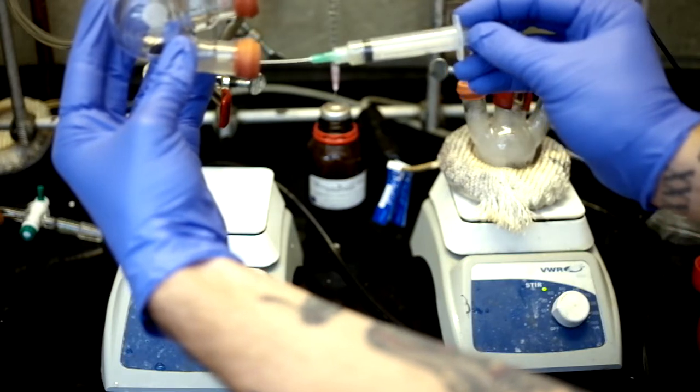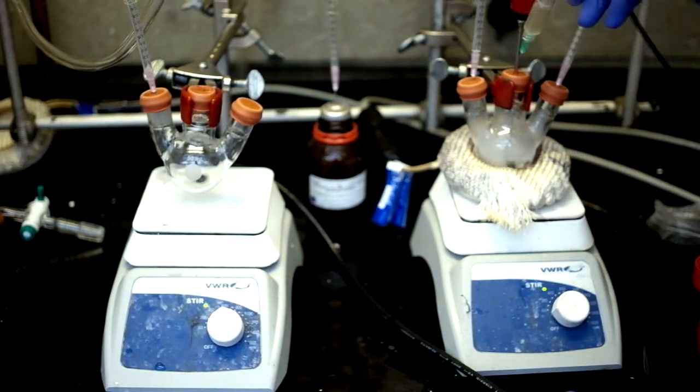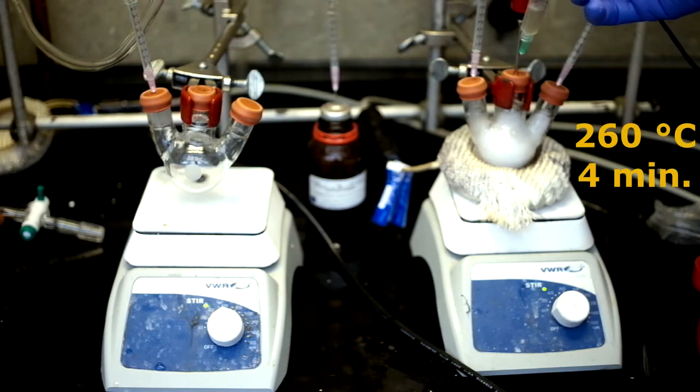Once the precursors have mixed, inject the entire precursor solution into the reaction flask at 260 degrees Celsius and let react for about 4 minutes.